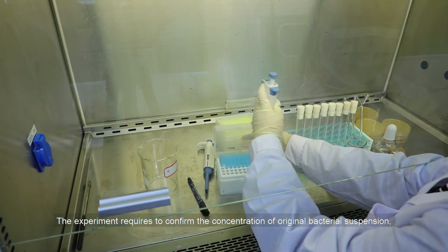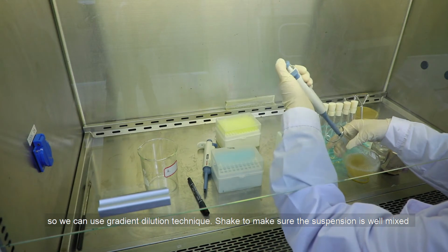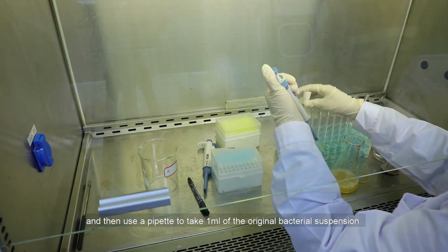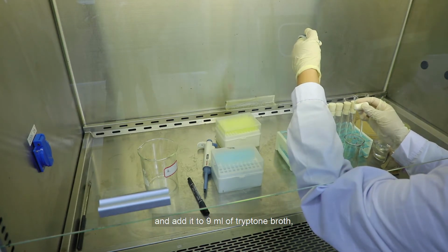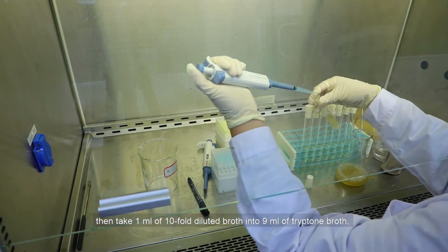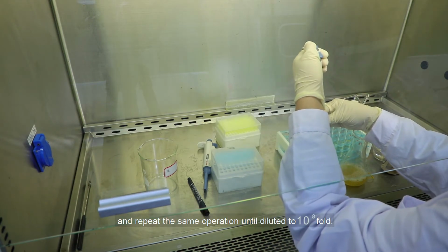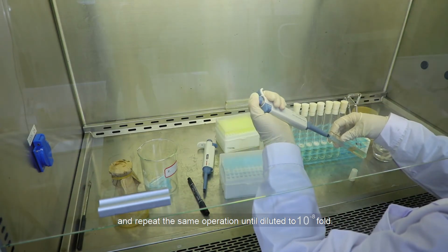The experiment requires confirming the concentration of the original bacterial suspension, so we can use the gradient dilution technique. Shake to make sure the suspension is well mixed, and then use a pipette to take 1 mL of the original bacterial suspension and add it to 9 mL of tryptone broth. Then take 1 mL of the tenfold diluted broth into 9 mL of tryptone broth, and repeat the same operation until diluted to 10 to the power of -8-fold.